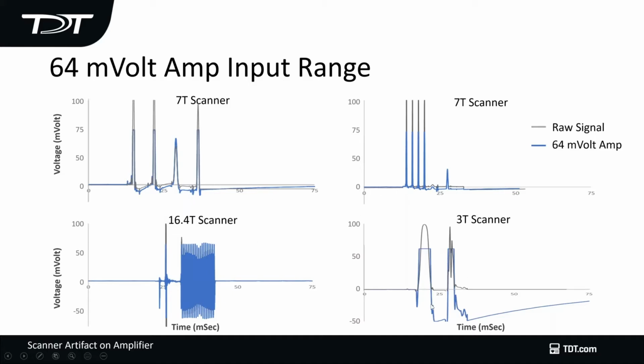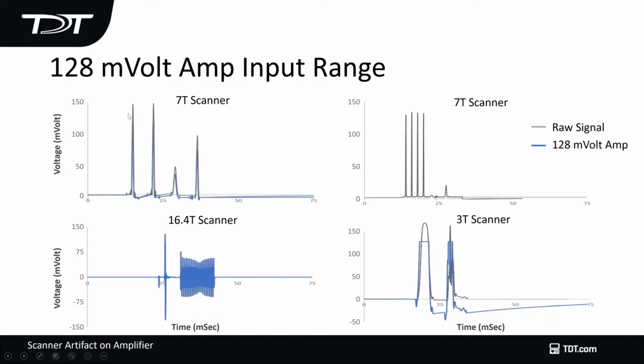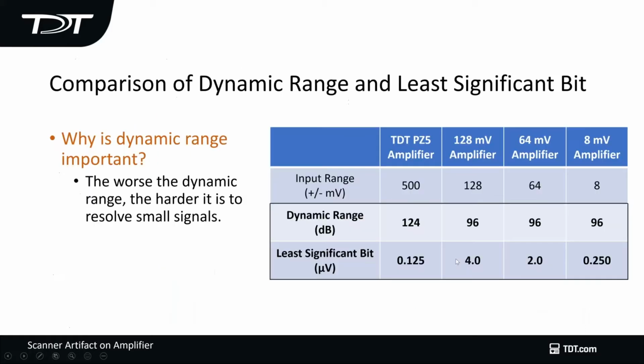And if I go to actually the 3T, which has the largest scanner artifact, I still haven't recovered after several hundred milliseconds. When you go to 128 millivolt input range, which is here, you compare that to the 500 millivolt input range of the TDT amplifier, it still saturates in several cases. And so if you don't saturate, which is one of the things that the TDT amplifier will not do, you will get a better reconstruction of your signal.